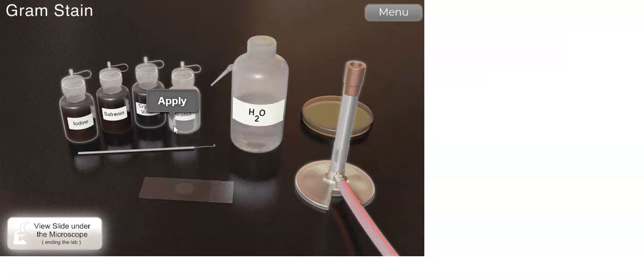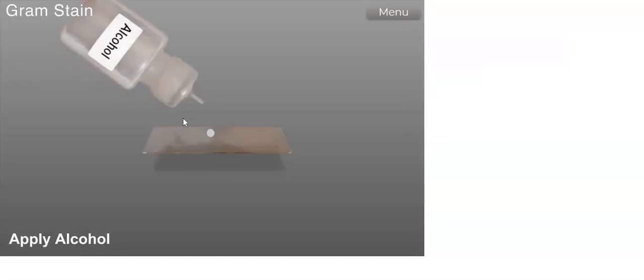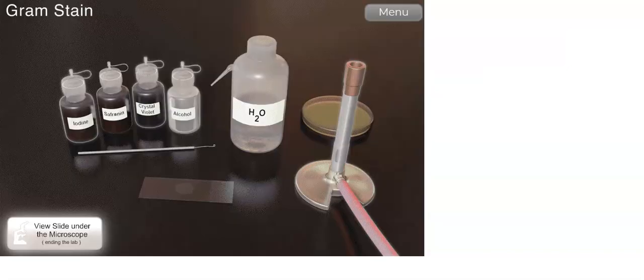And then we're going to apply the alcohol. Alcohol here acts as a decolorizer. This alcohol decolorizes the color of the sample. The alcohol dissolves lipids found in the outer cell membranes of gram-negative bacteria, allowing the crystal violet iodine complex to leak out through the thinner peptidoglycan.